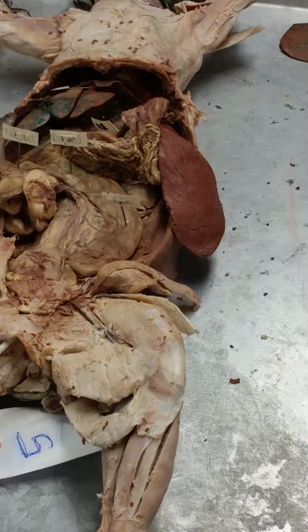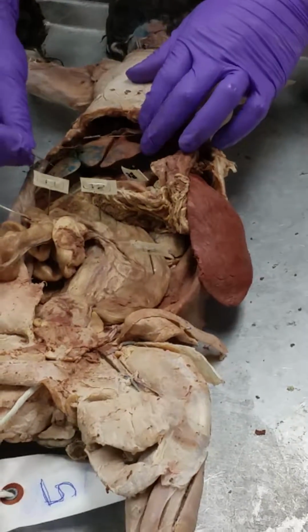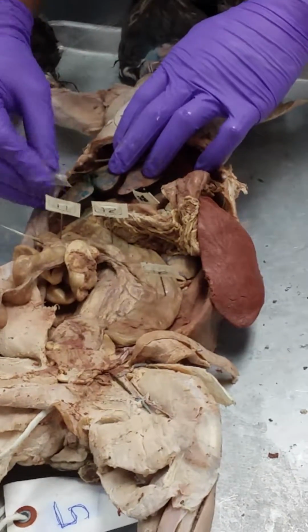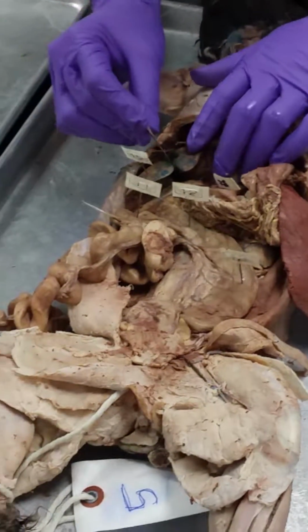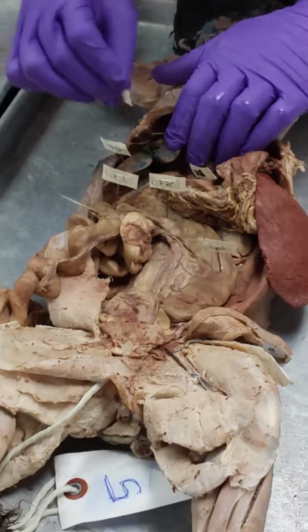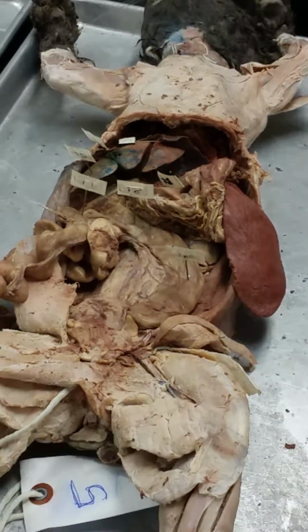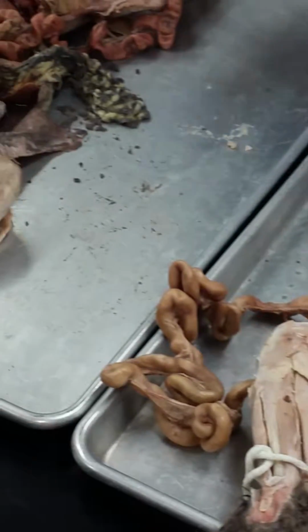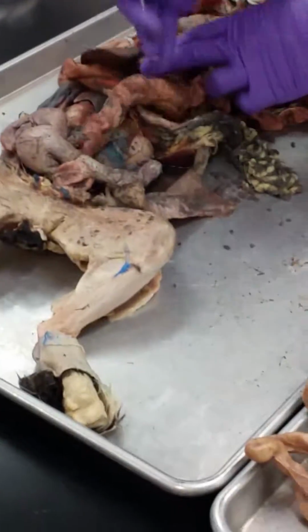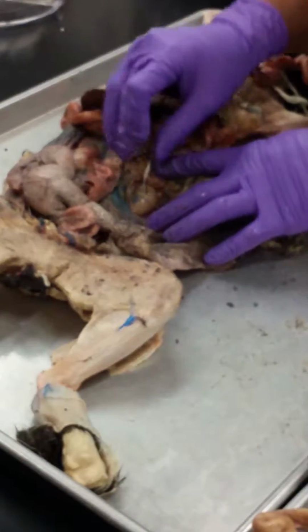Okay. Liver. 15, that's 15. So here's the liver, right? Multiple lobes. Gallbladder. 16, right there, nice green gallbladder. Alright, 17. Kidneys. Kidneys, who's got some nice kidneys to see right there. And right here is the whole kidney. So we'll just poke that in there.